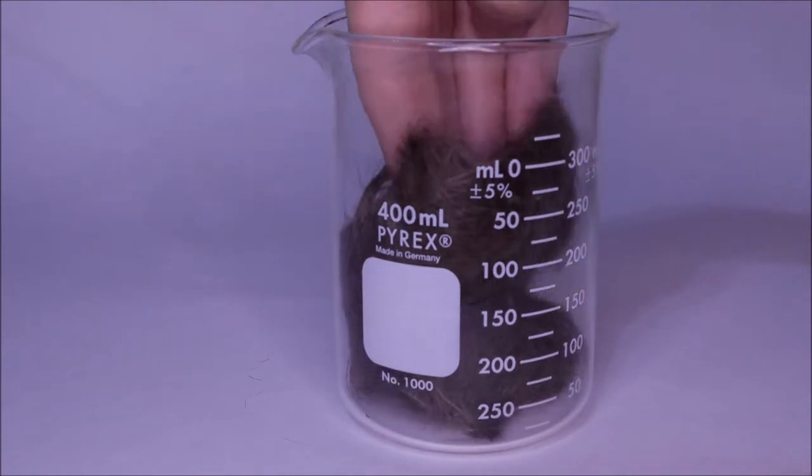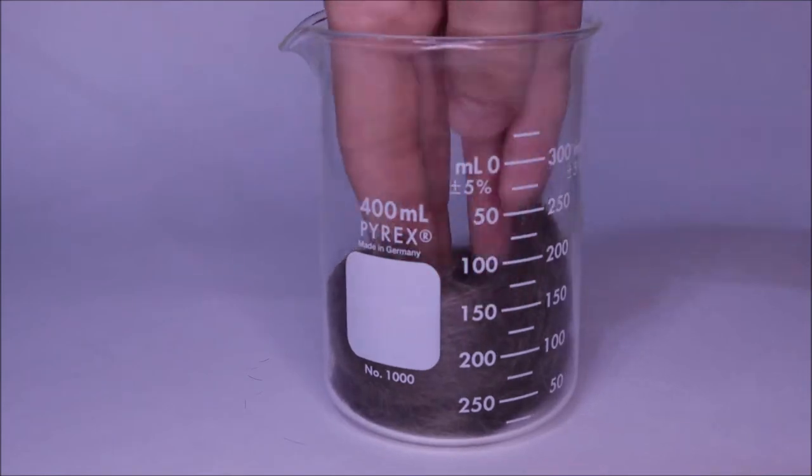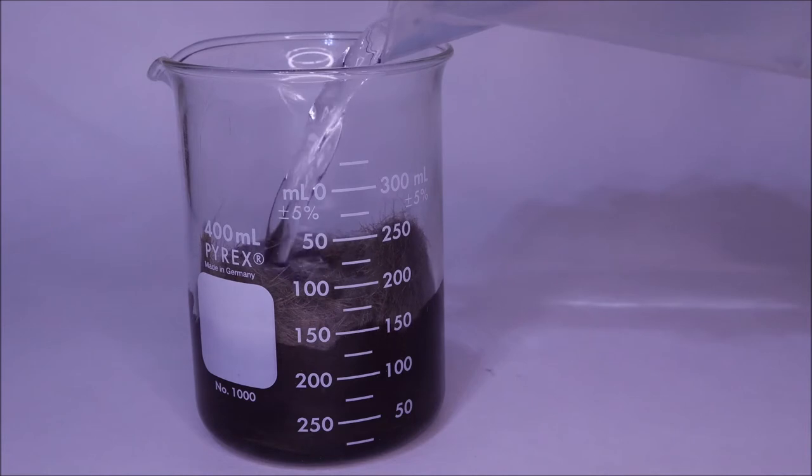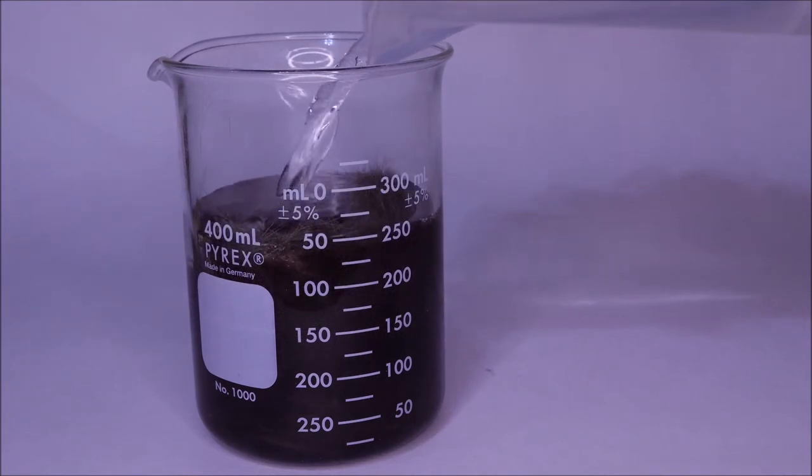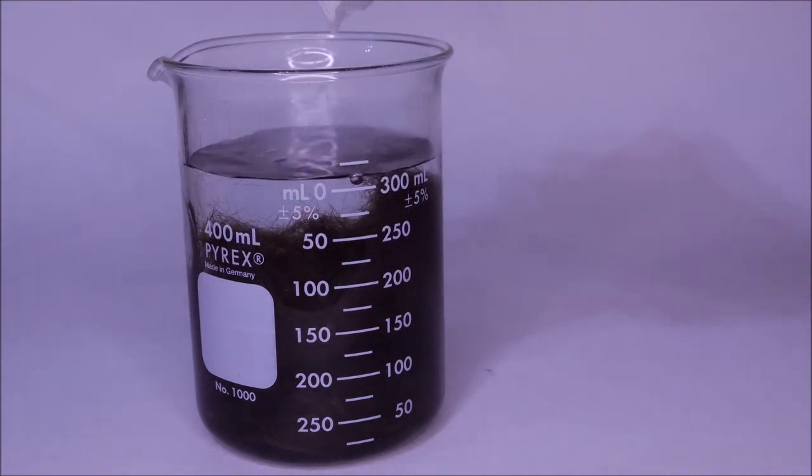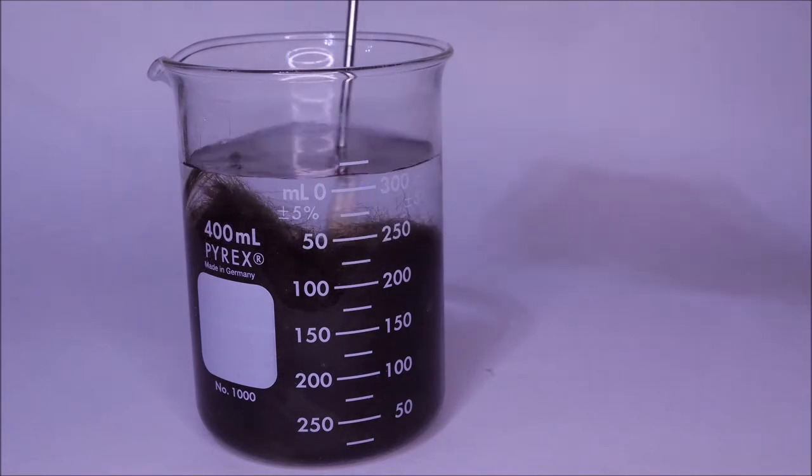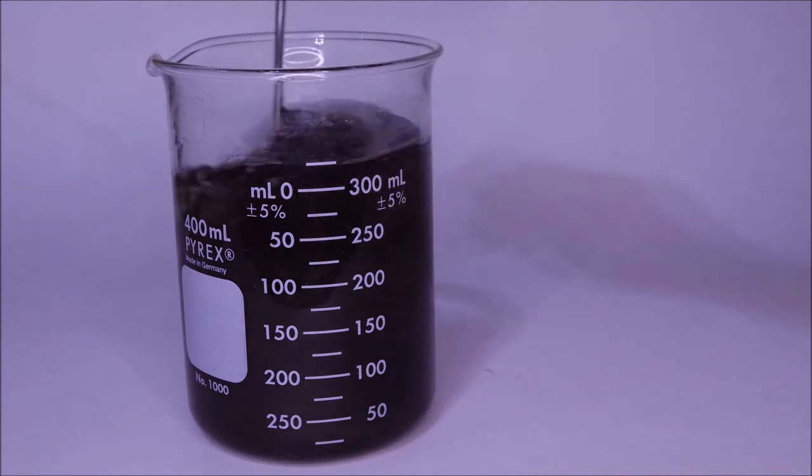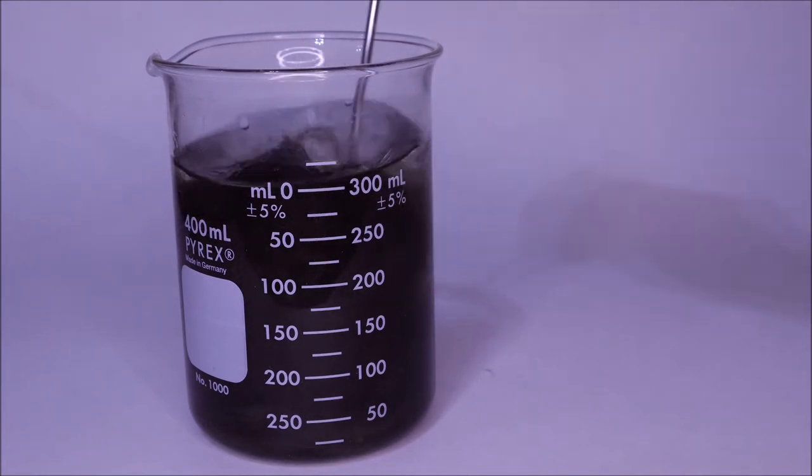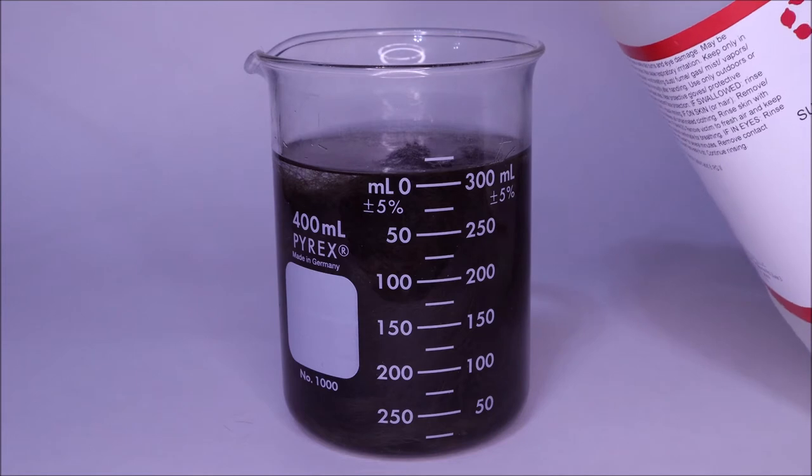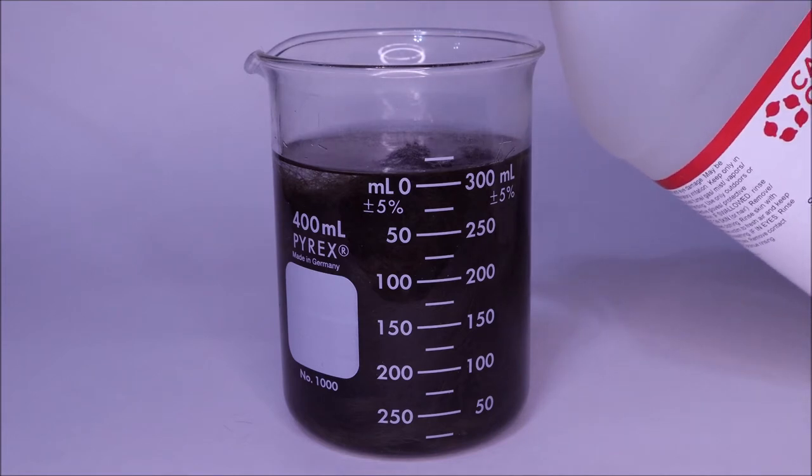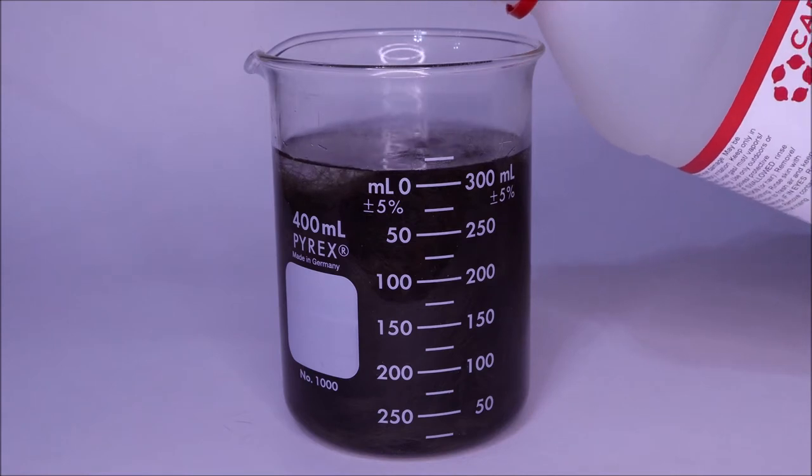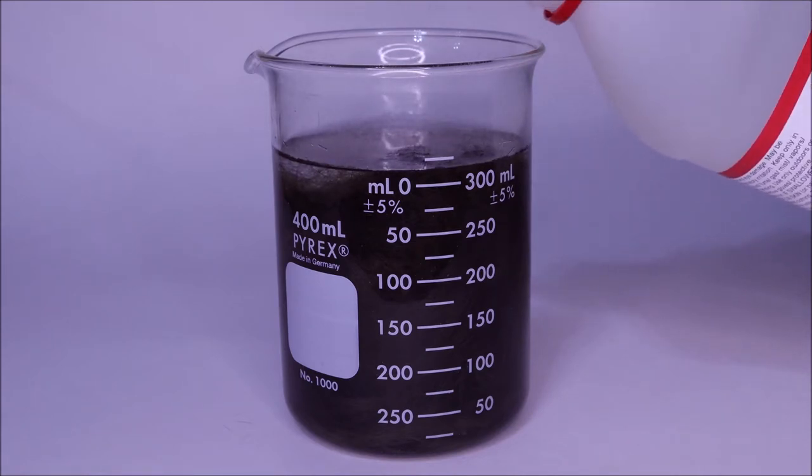I stuffed it down to make sure that I could fill as much water to the top without it splashing out. Now I wanted to work on making my acid solution that I was going to be doing the hydrolysis in. Of course, hair does not mix too well with just straight water, but the hope was that as per that other YouTuber's video, it would slowly begin to become better dissolved as time went on.